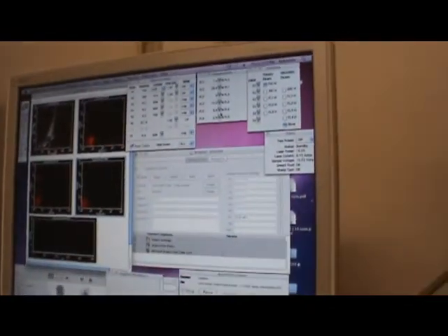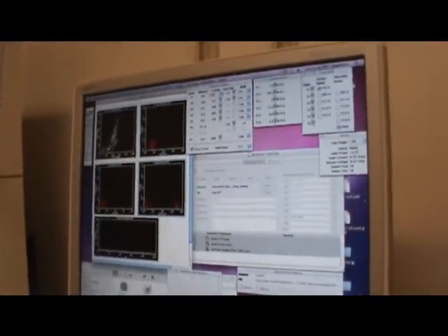Then we throw APC. Pause, restart. See, this is APC. And if the voltage is, wow, it's very bright. So if you want, you can decrease the voltage a little bit. Pause, restart. See, this is fine. And then this 4 and 3 you want to play with. FL4 and FL3. So let's see what happens. FL4 and FL3, okay? So this is 6.9. Pause, restart. Nothing happens there.